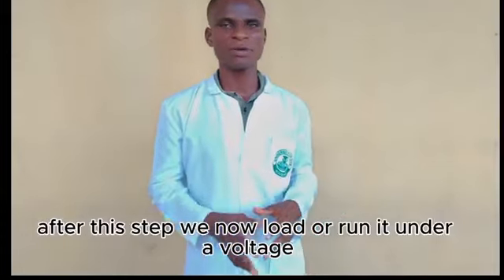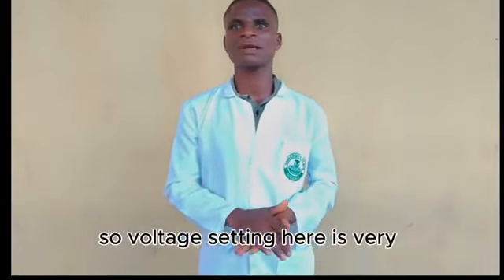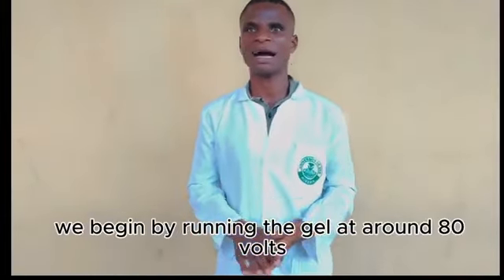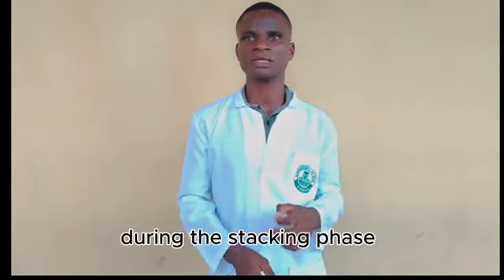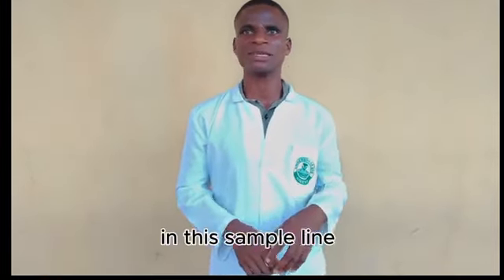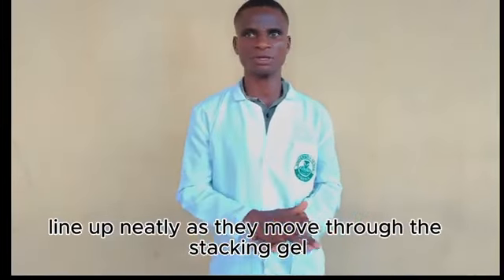After this step, we now run it under a voltage. So the voltage setting here is very important for separating the proteins effectively. We begin by running the gel at around 80 volts during the stacking phase. This low voltage ensures that all proteins in each sample line up neatly as they move through the stacking gel.